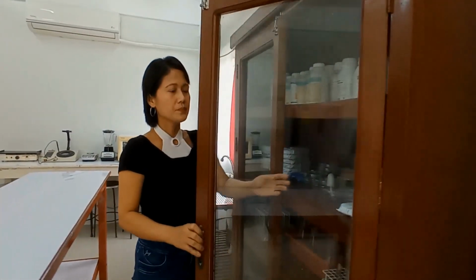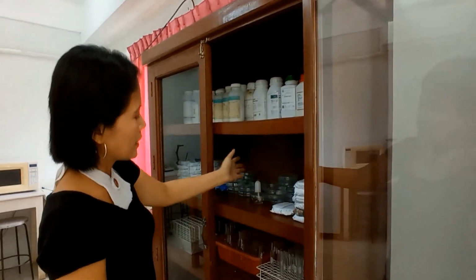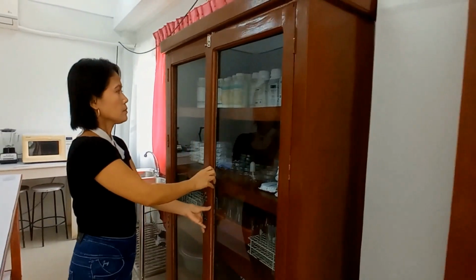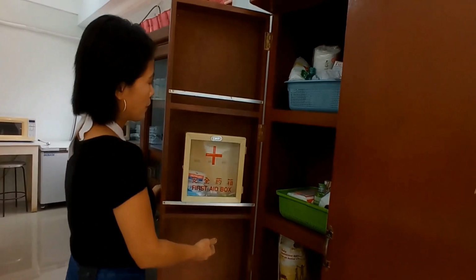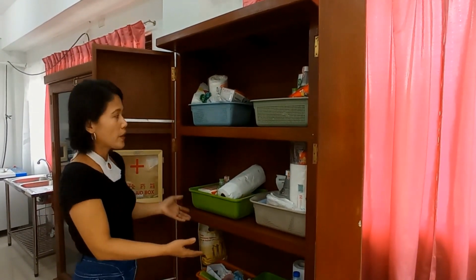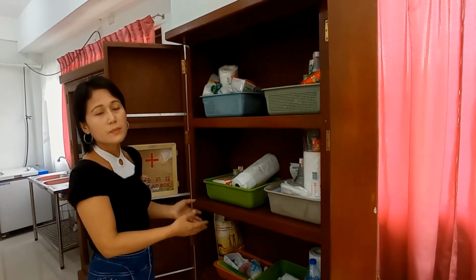Okay. So here we have our cabinet. So this one contains our culture media. We have a bit of Petri dishes in here and test tubes, and I still have lots of them hidden somewhere. Okay, so and other things also. Another cabinet we have in here. Oh, what is this for? First, we have here our first aid kit. And inside is actually the storage area of the materials being used by the students. And these things in here are the materials that my students were using just before the pandemic.